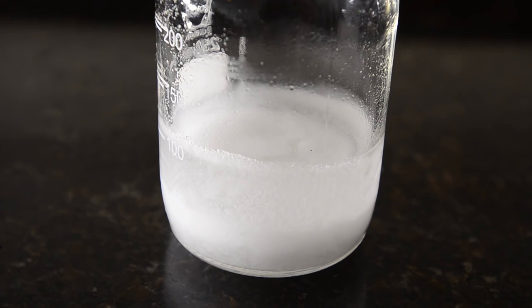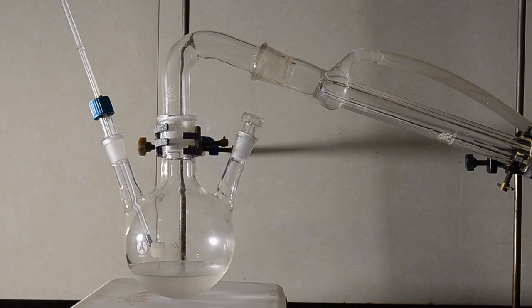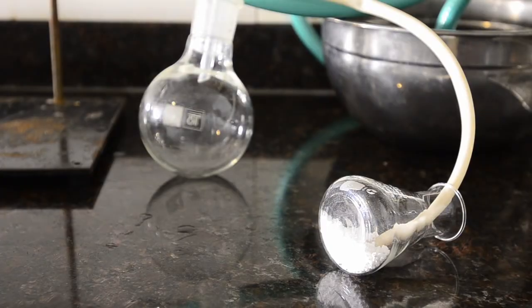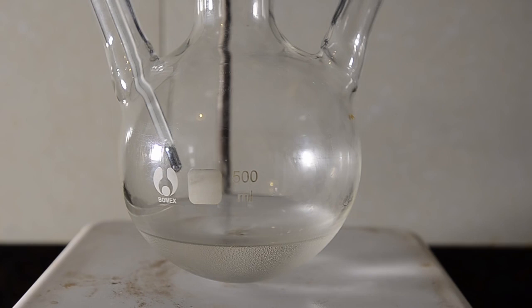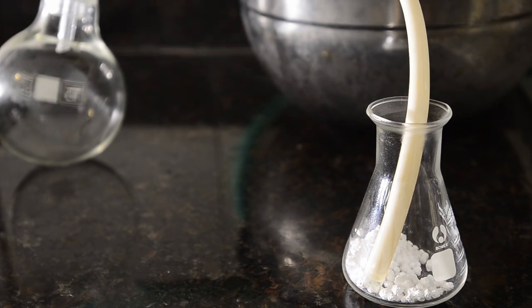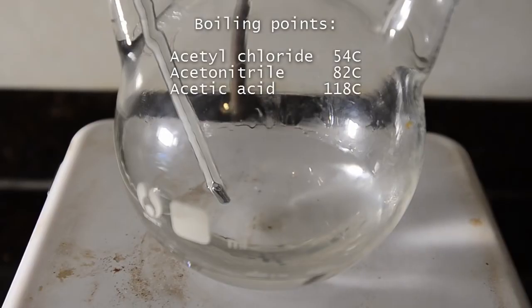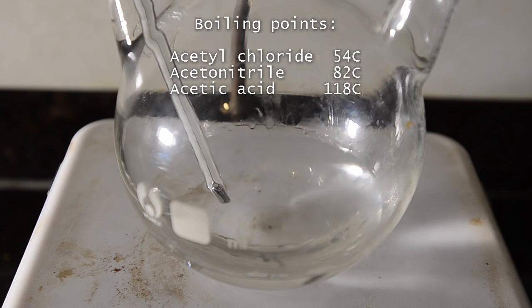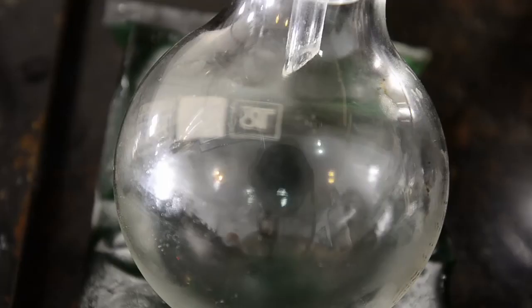We decanted off the liquid from the crystals and set up for distillation. The liquid fumed in air and gave off a lot of HCl gas, so we strongly advise using a lot of ventilation. We used another makeshift calcium chloride dry trap. As the liquid warmed, a lot of HCl gas was produced, presumably dissolved in the solution. At around 50 degrees C the liquid started to bubble with some refluxing, and then at just before 60 degrees C we saw a colorless, clear liquid distilling off. Distillation was quite slow and we tried to keep the temperature down to avoid distilling any acetonitrile, which we figured would also have a fairly high vapor pressure at this temperature.